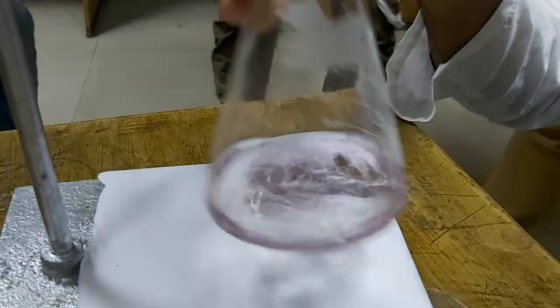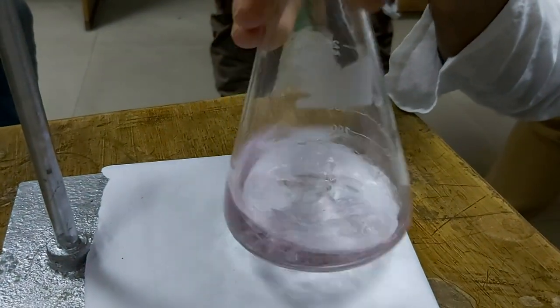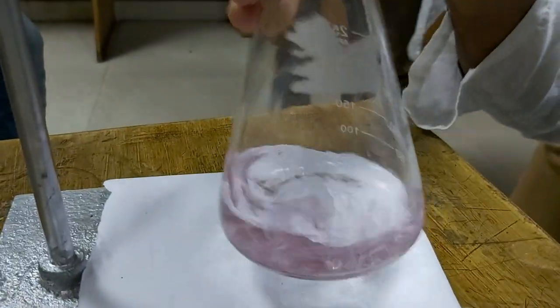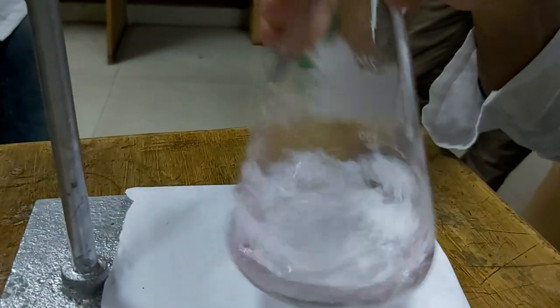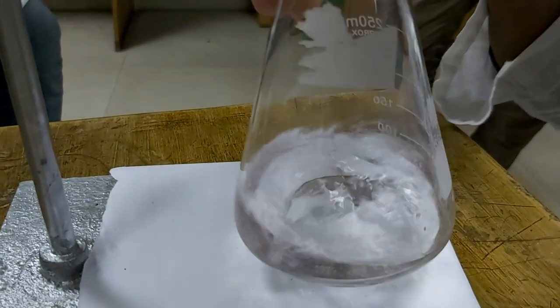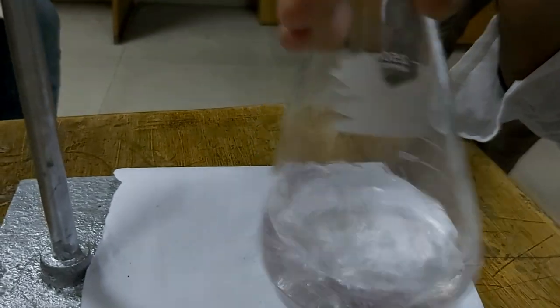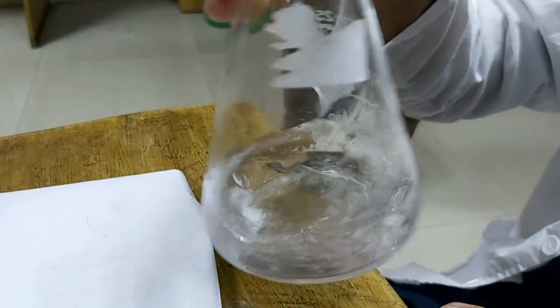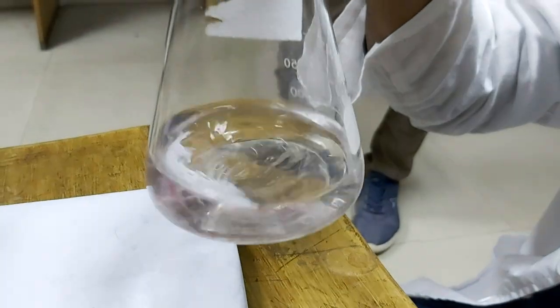We are moving towards the endpoint of this titration, and the color should change from pink to colorless. The color has gone, and now it is colorless. The endpoint of this titration is a colorless solution.